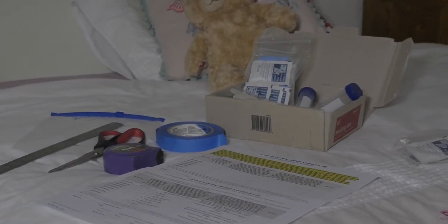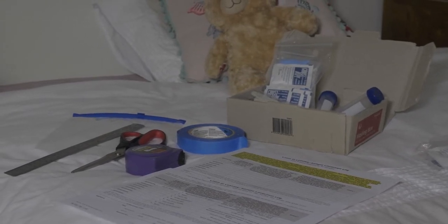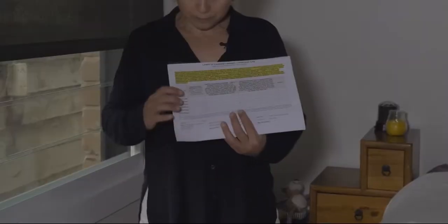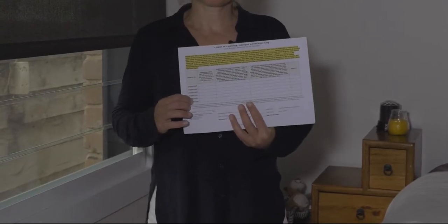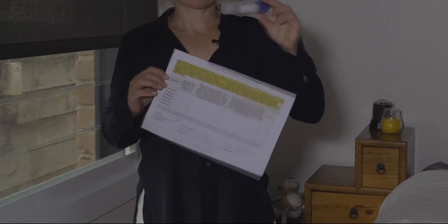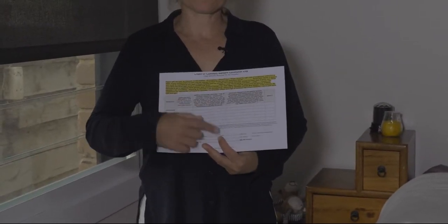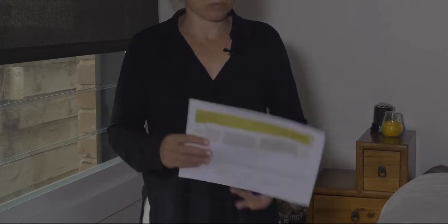And the first of those is the chain of custody provided by the lab. On the chain of custody, you'll notice a sample number, and this number needs to be on the test tube that's provided, or the container provided by the lab. You'll also notice that you need to provide a description and the area that was sampled. So it's going to look something like this.